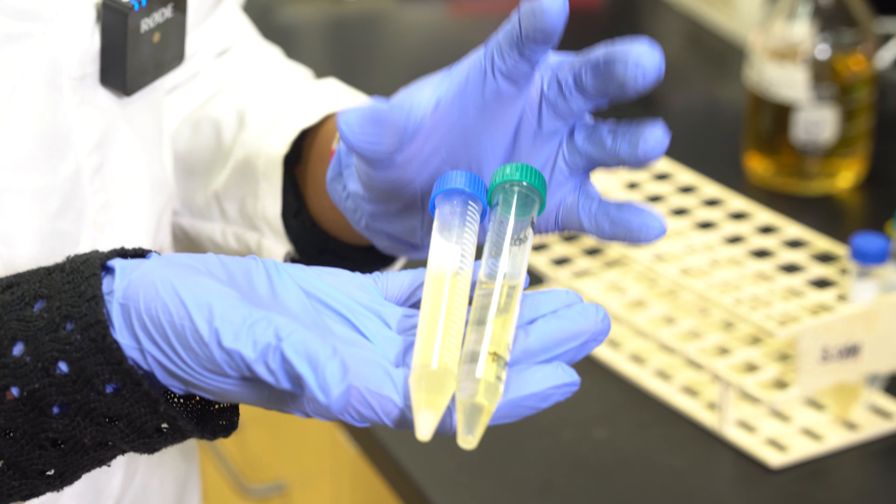Once you have acquired the microorganism from the incubator, you will have noticed turbidity and also dense particles at the bottom of the tube. This will indicate that growth has taken place, and you can notice when compared with the tube with just TSB, growth has taken place.